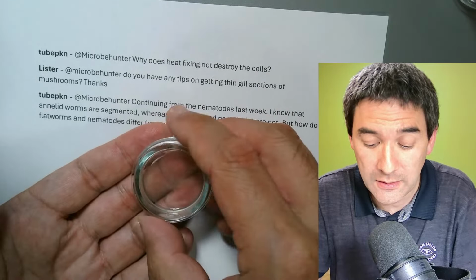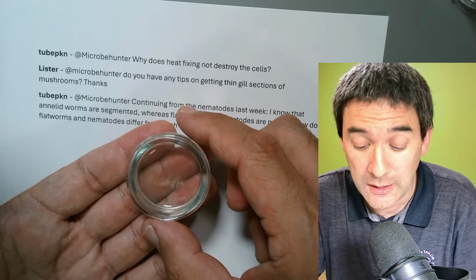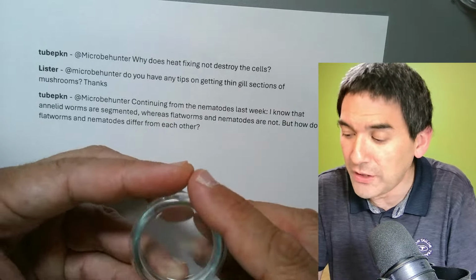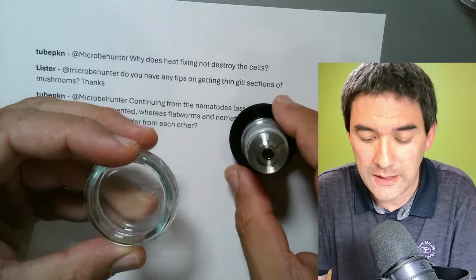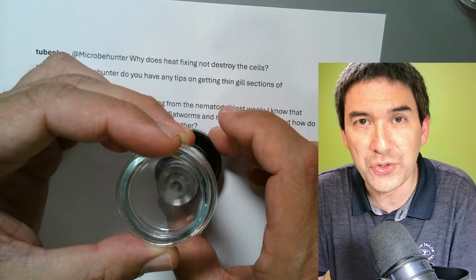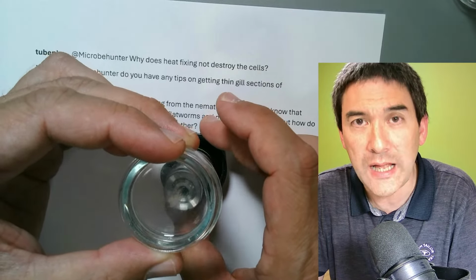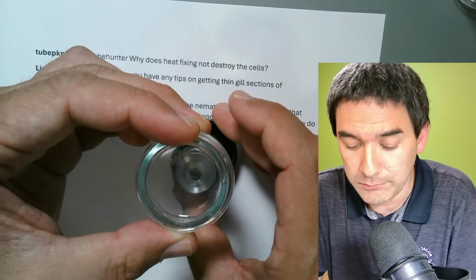For example, when you grow cells in a Petri dish or in cell culture, you basically place it on the stage of an inverted microscope. The objective is on the bottom. So this allows you to observe the specimen without actually having to make a slide. You just leave it in the Petri dish, put it on top, and observe it.